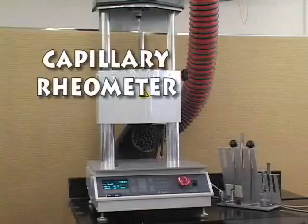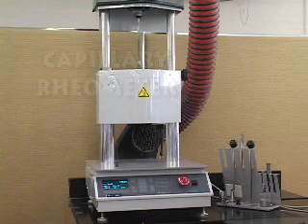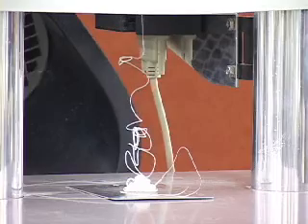This apparatus is a single-bore capillary rheometer. It is used to examine the rheological properties of plastics. For example, how a material's viscosity changes with shear rate under specified conditions of temperature and capillary size.